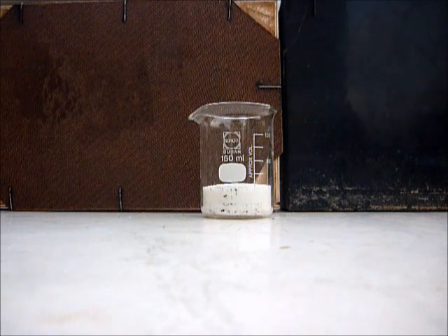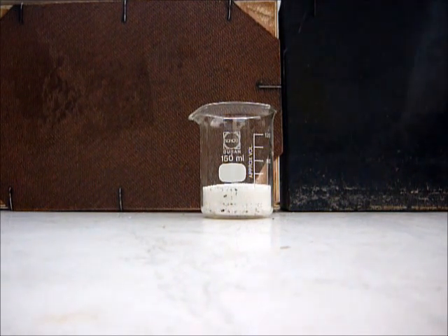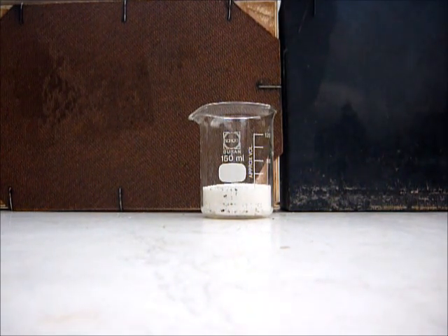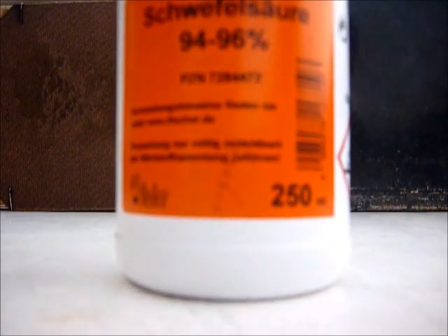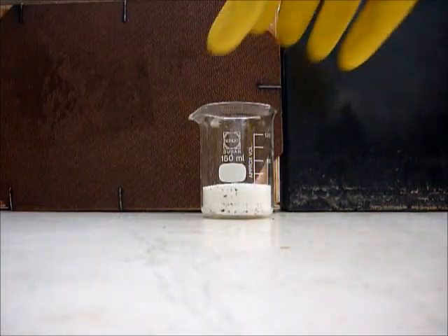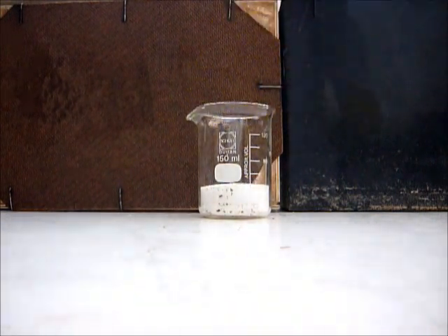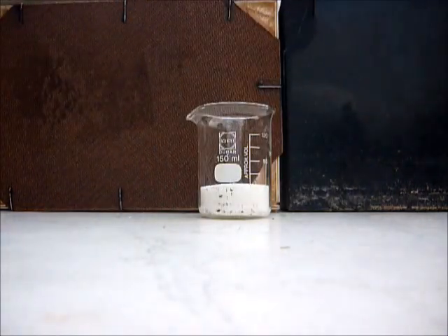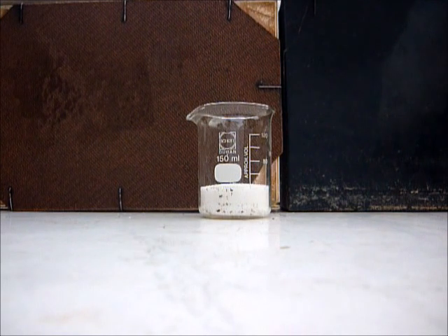Hello and welcome to one of my new videos. In the previous video I showed you the dehydrating properties of concentrated sulfuric acid with paper, which is burned by the sulfuric acid. Now I will try it with sugar.